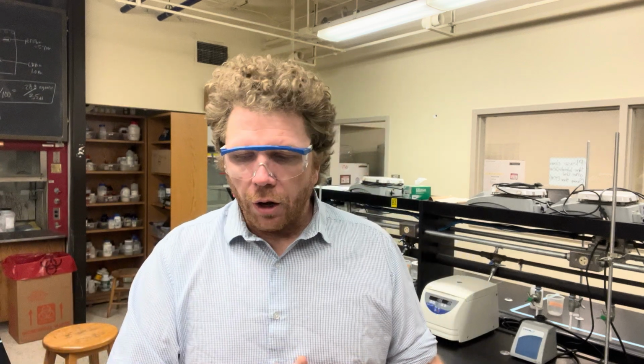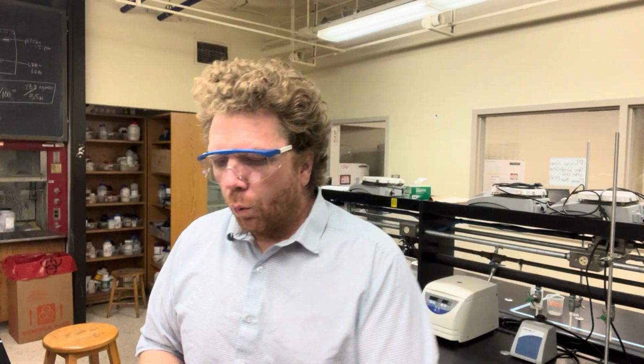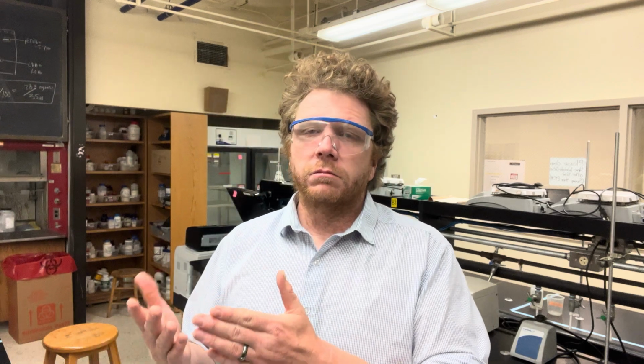So when you're working with an unknown protein, however, you have no clue what the concentration is going to be. And whenever you measure that concentration, if it's extremely high or extremely low, it might fall outside of the boundaries of the Bradford assay that you previously did. And so what we're doing here is we are going to take an unknown protein sample and take 100 microliters of it, mix it with the Bradford reagent, and determine the absorbance of that sample. Okay. If that absorbance is higher than our highest known protein sample, we have to make a dilution of that. We have to make a dilution and then kind of work backwards and say, okay, well, it's 1 part this, 1 part this. What is my concentration?